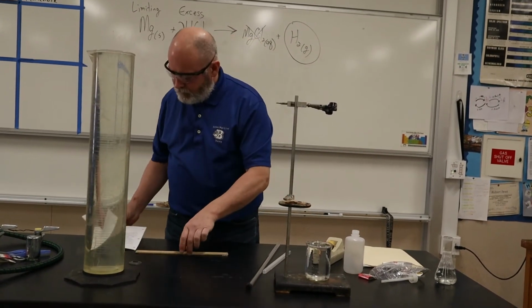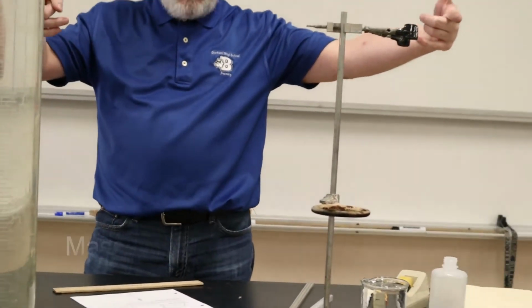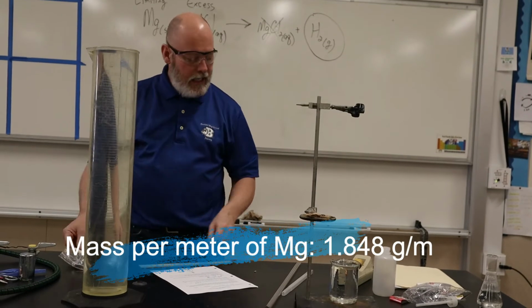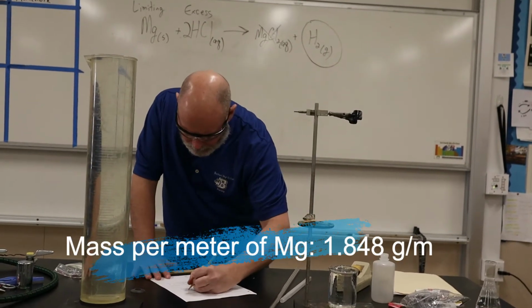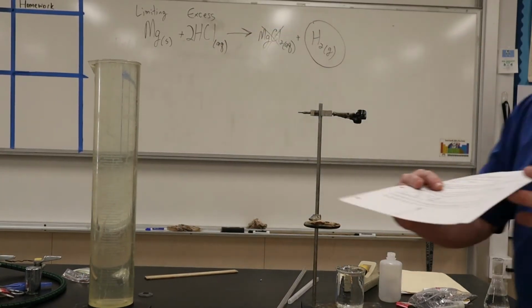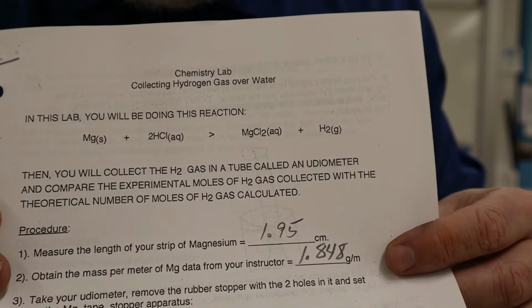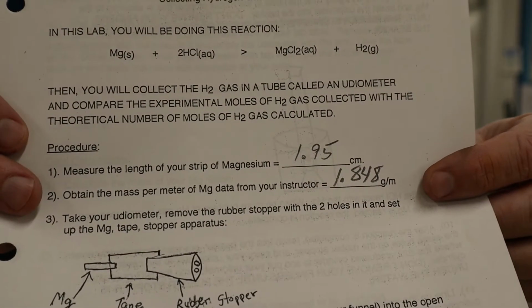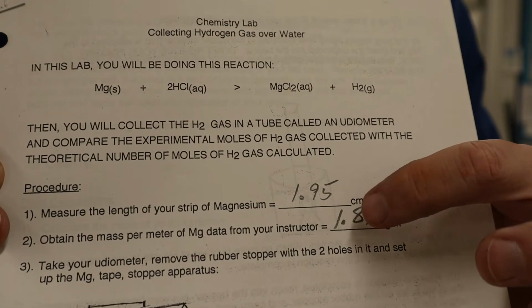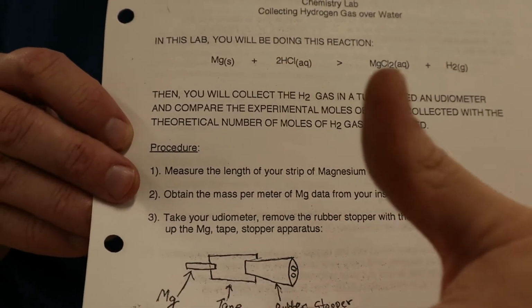Last year my TA measured out a meter's length of this magnesium. A meter of this magnesium is 1.848 grams, so 1.848 grams per meter. Just to show you real quick: number one, I measured it, it's 1.95 centimeters. Number two, last year my TA measured a meter's length, so it's 1.848 grams per meter, and that will be in our calculation section. We'll use that later.